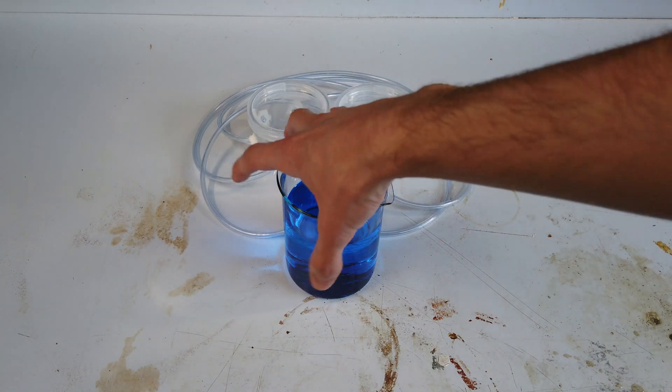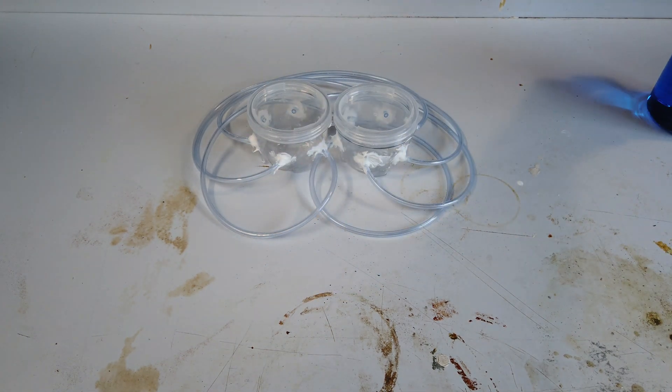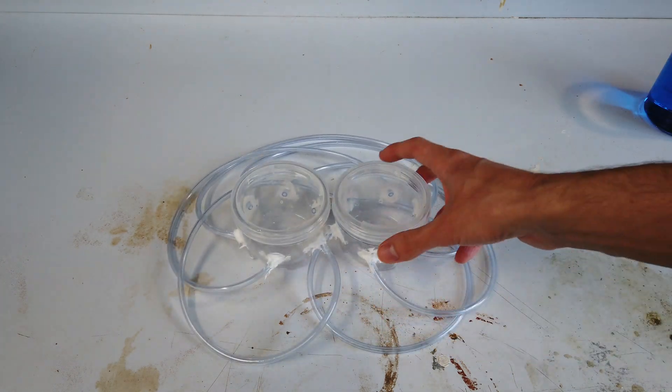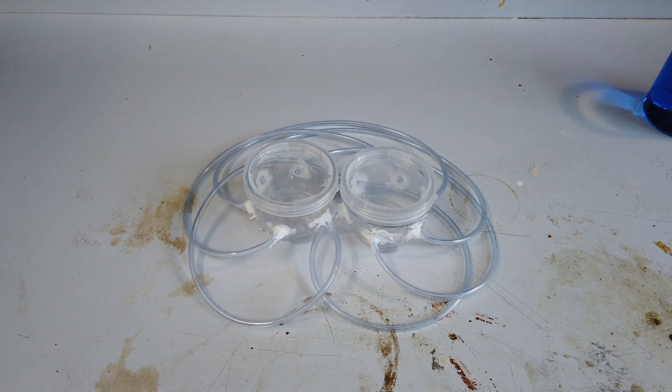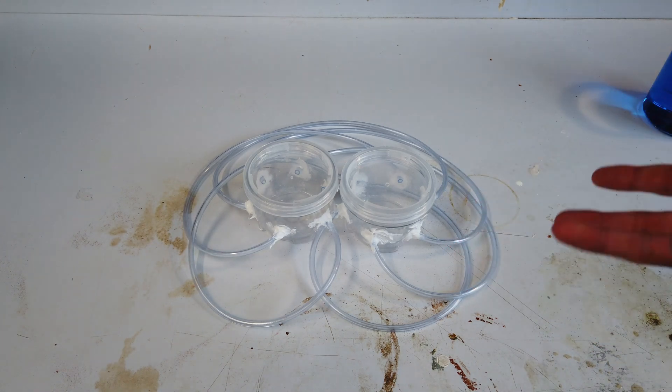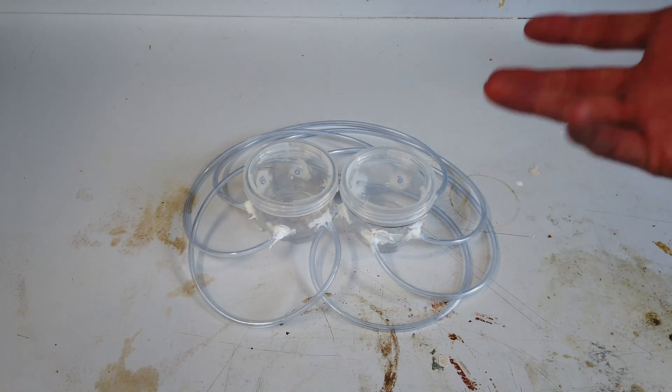Instead, that is why we have built this kind of monstrosity of a contraption. Basically this is a way to increase the distance between the electrodes without building a really massive cell.